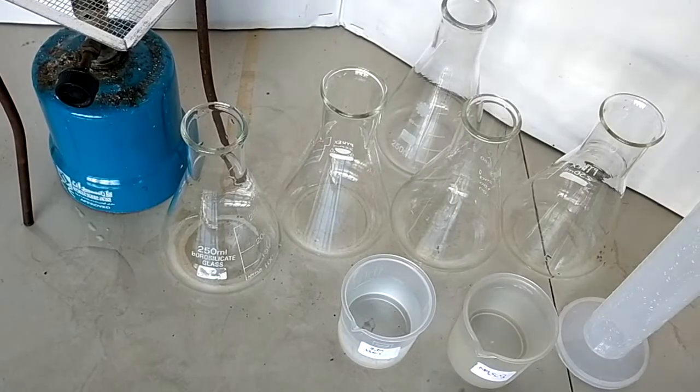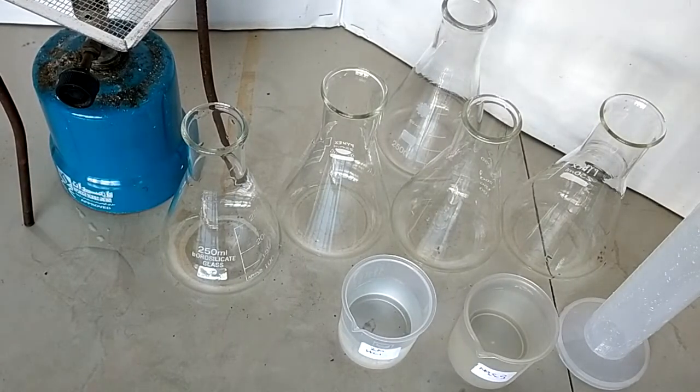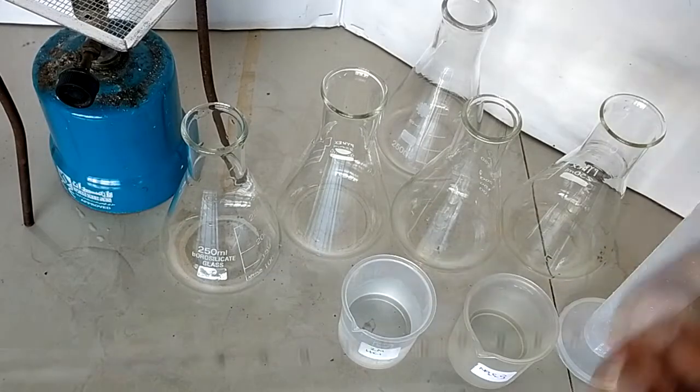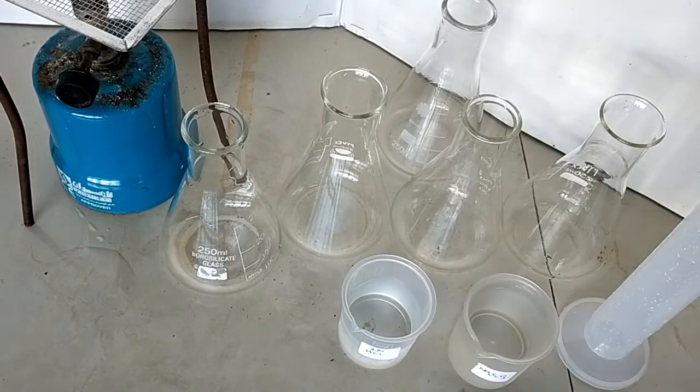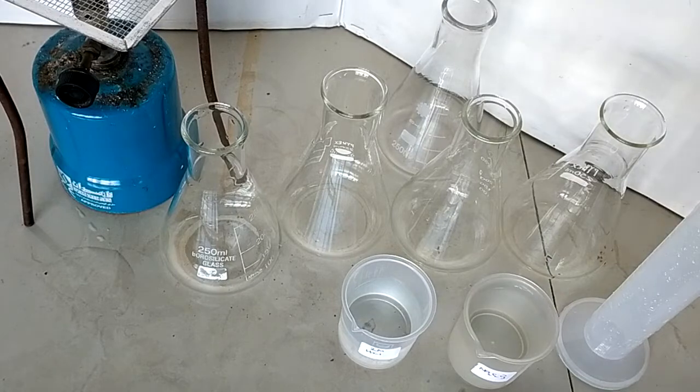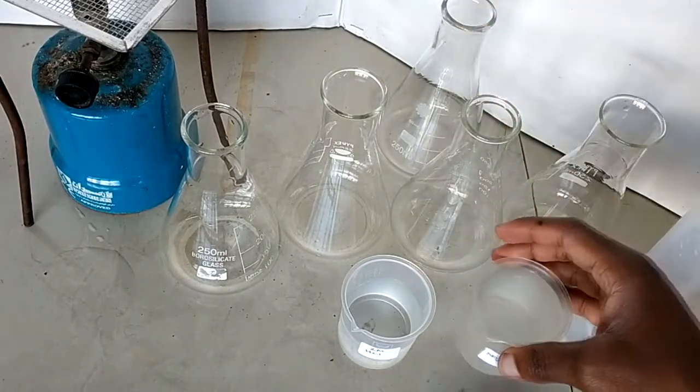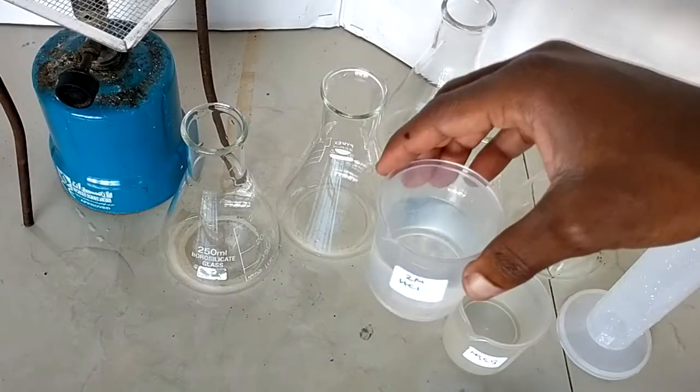Okay, in this experiment we're going to investigate the effect of temperature, which you shall be measuring with the thermometer, on the rate of reaction. We shall need two reagents: number one is sodium thiosulfate and number two is two molar hydrochloric acid.